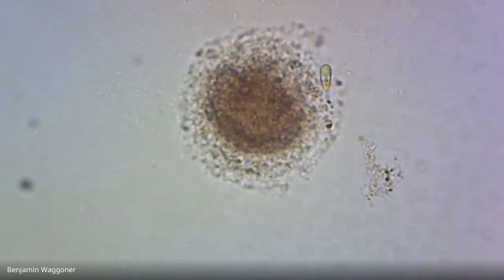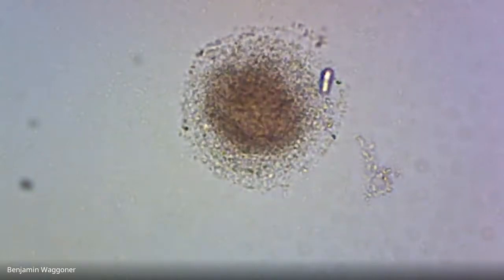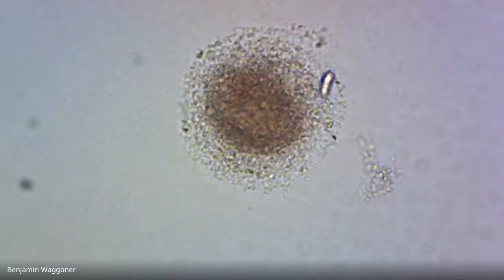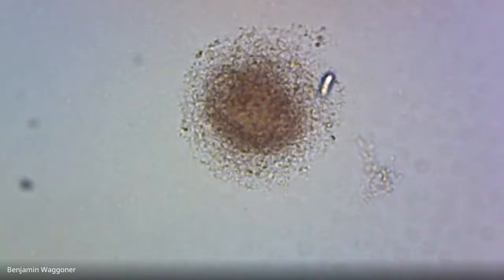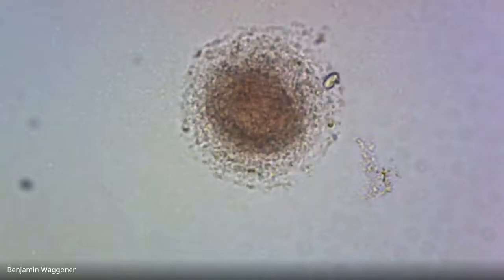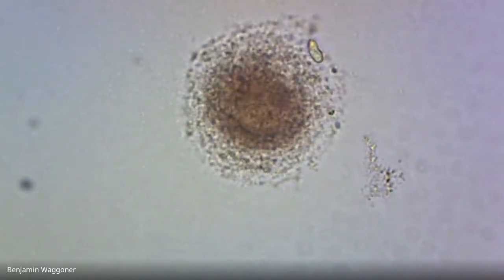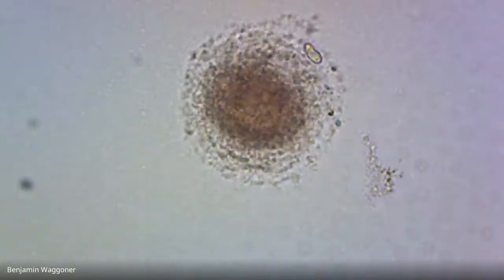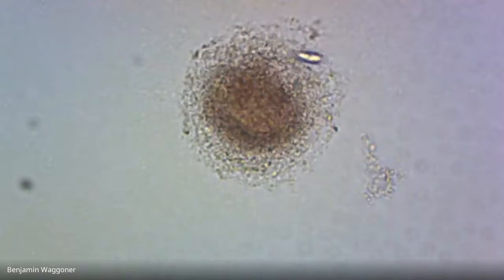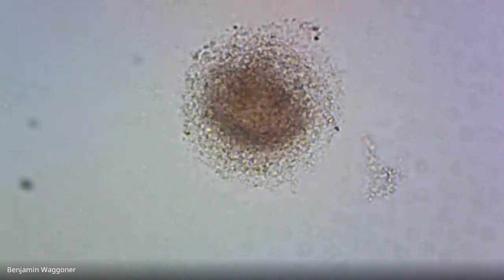Okay, that is probably an egg, or it could be an embryo. Either way, all of the wriggling stuff inside, that's probably little particles getting bounced around by Brownian motion. There's also a little ciliate feeding on it. So actually, some of those could be bacteria too. Yeah, I think that's an egg that's being attacked by bacteria, and we probably shouldn't count it.